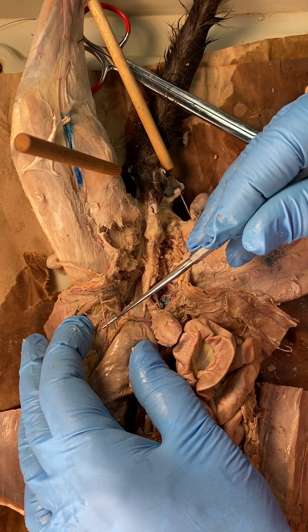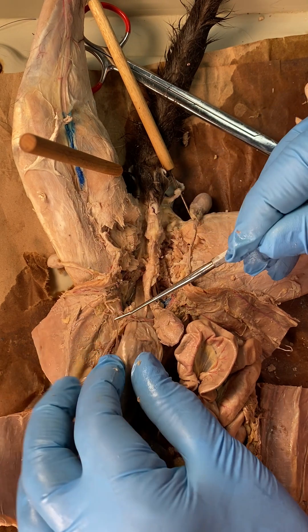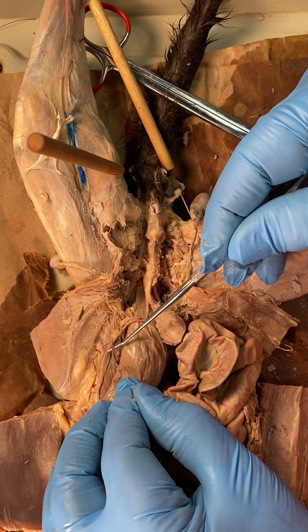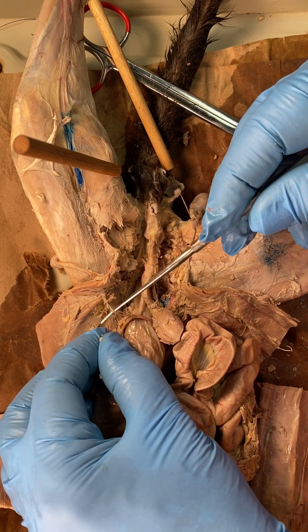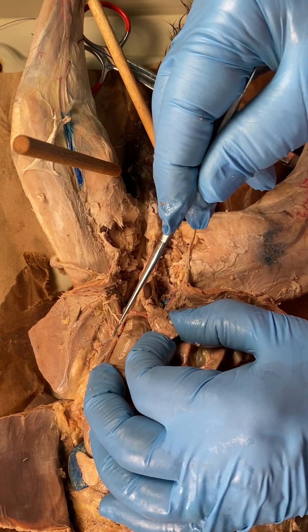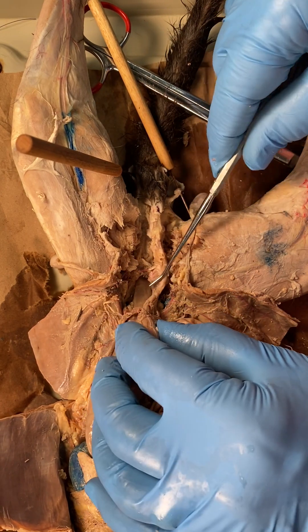There's the vas and there's the spermatic artery. The spermatic vein on this side was so tiny it couldn't really be seen — it was kind of lost in the dissection. There's a piece of it right there, but it didn't even take up any of the blue dye color. I'm not going to follow that back any further because it's too small.